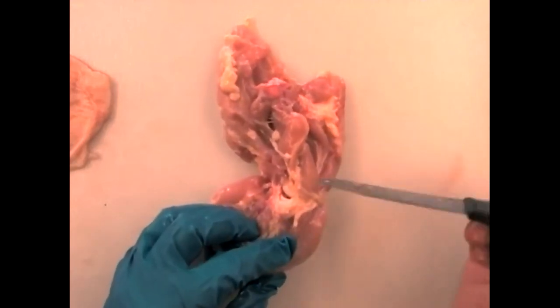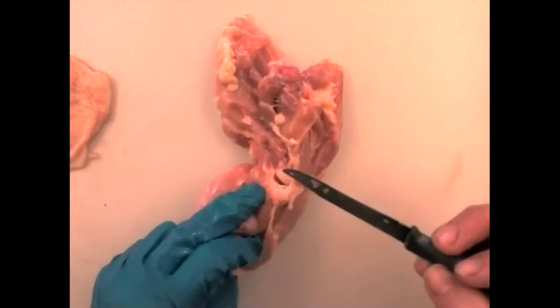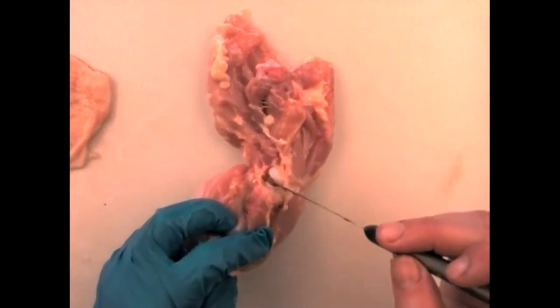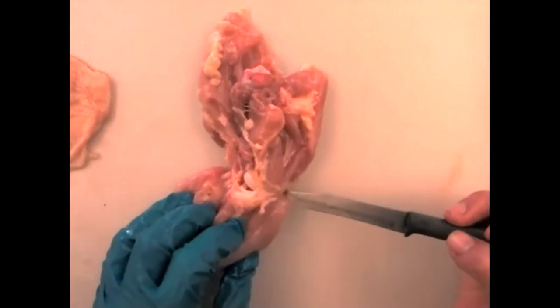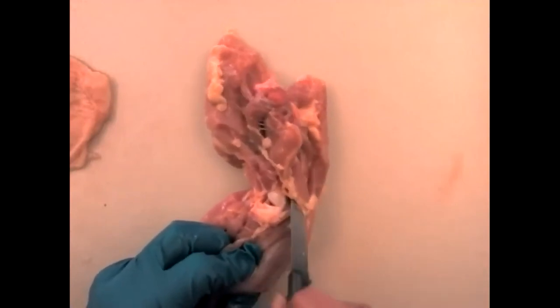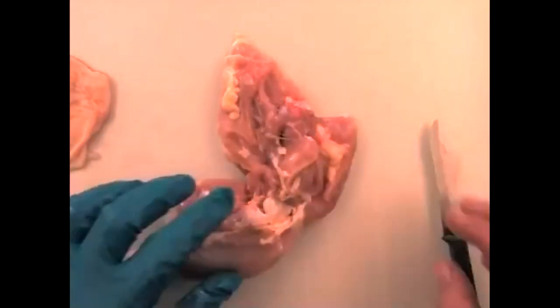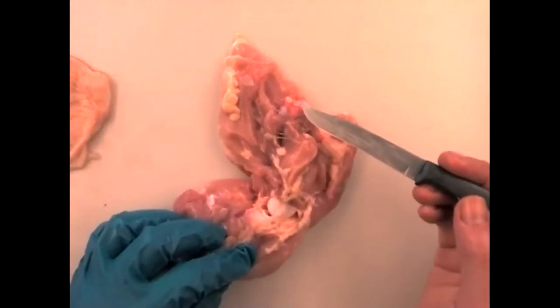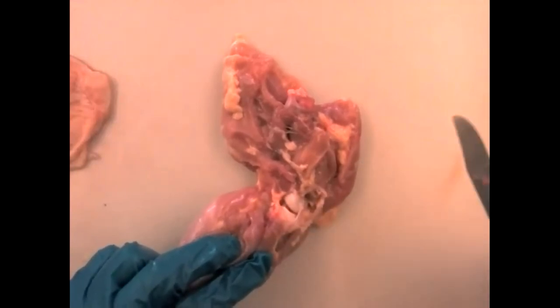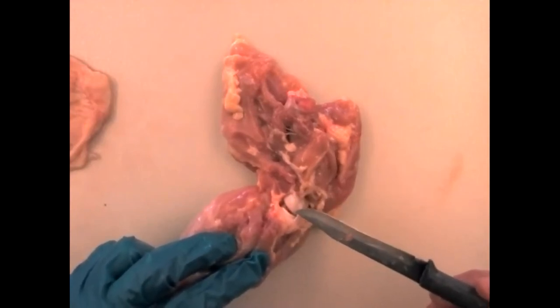Around any synovial joint there's going to be a ligamentous capsule — you'll feel that this area is a lot harder than the surrounding muscle tissue. Gently slice it away; we don't want to damage the knee. What we're starting to see is the femur. These really smooth, lovely articular surfaces are called condyles, and they are covered with articular cartilage — hyaline cartilage. Feel them with your finger — they feel smooth and slippery.